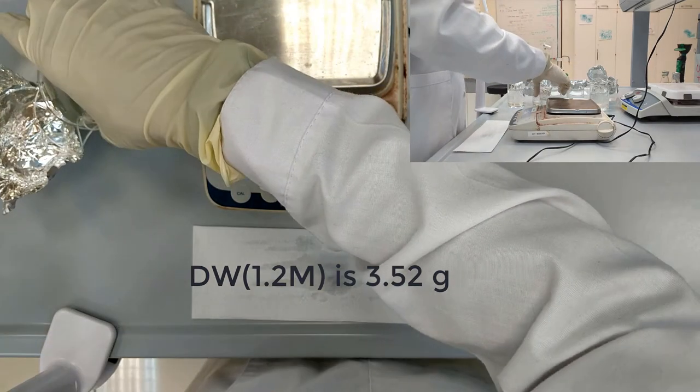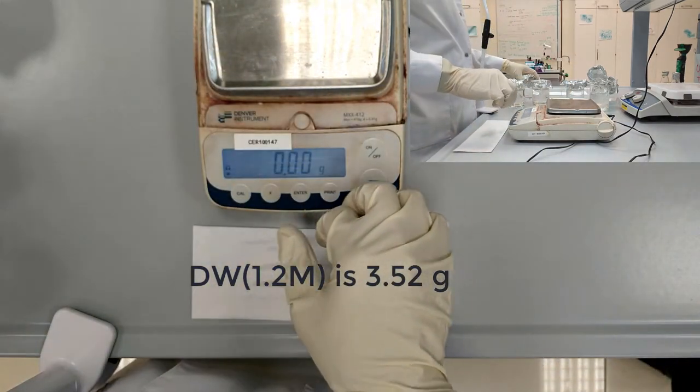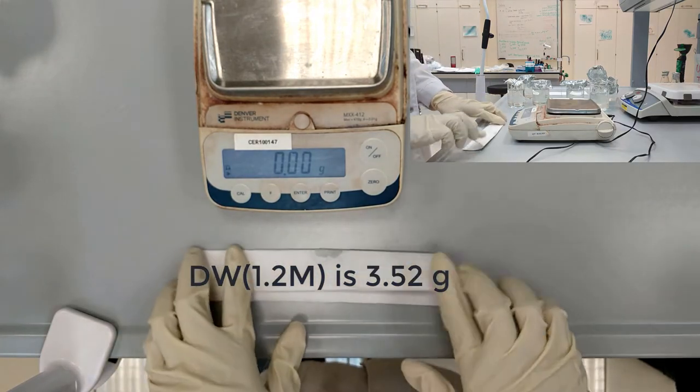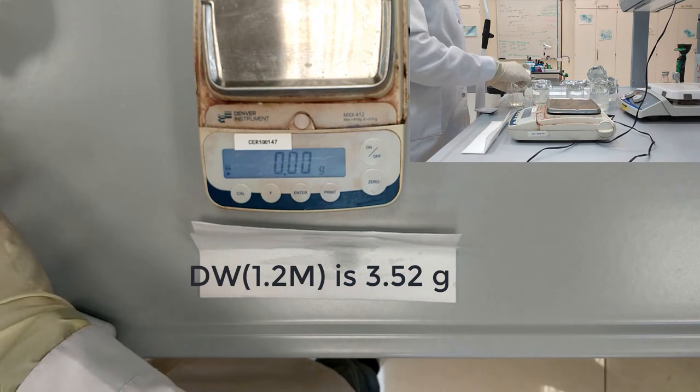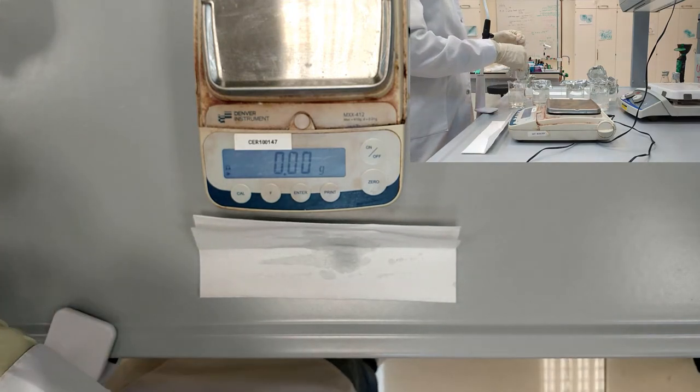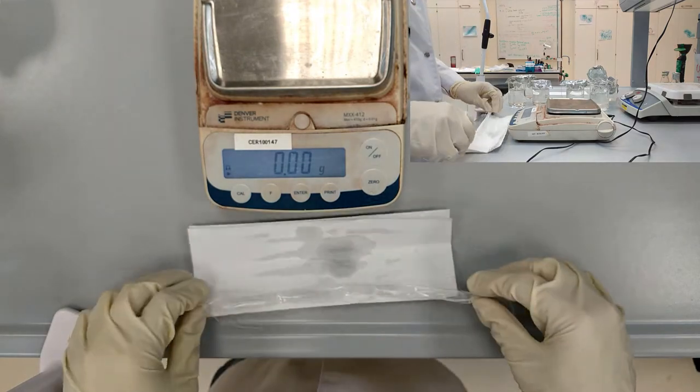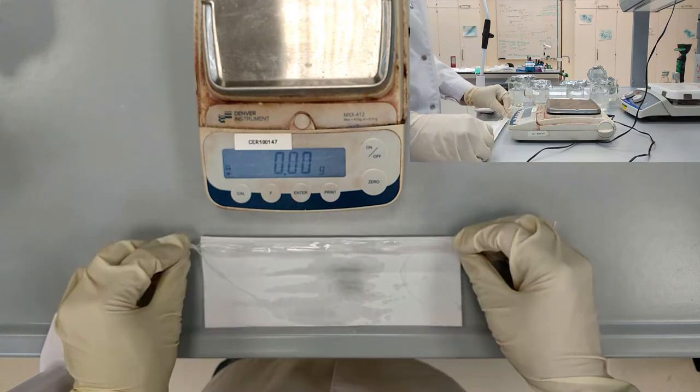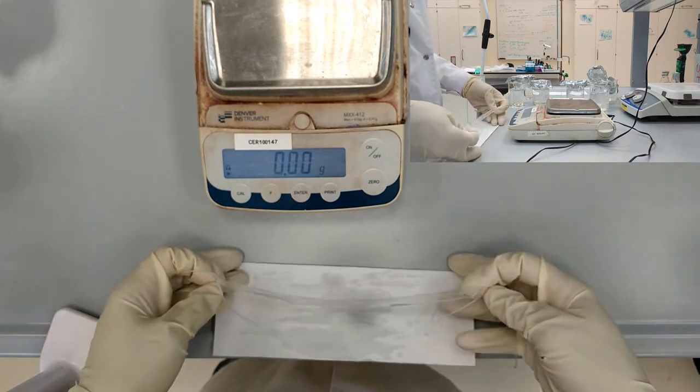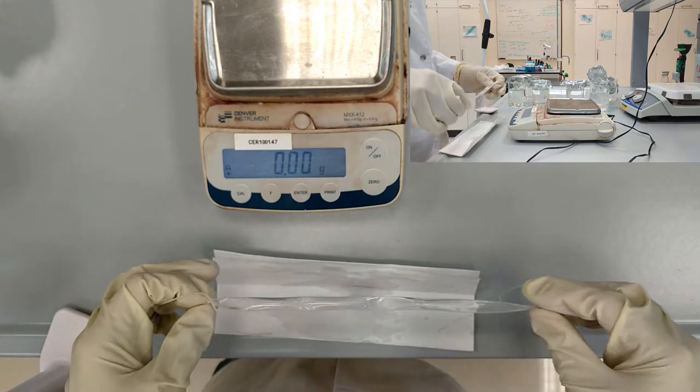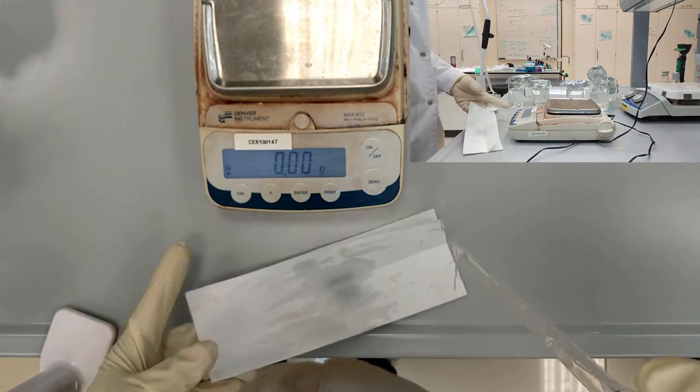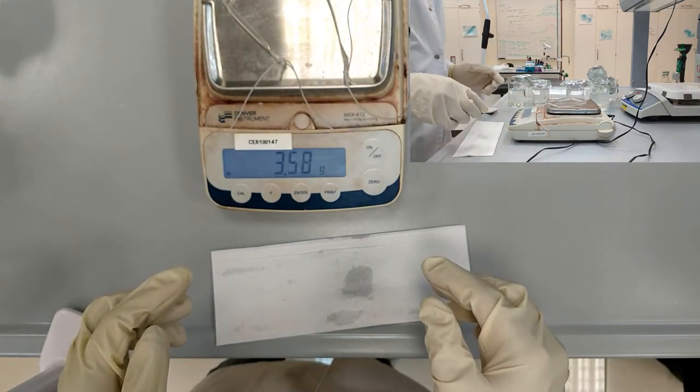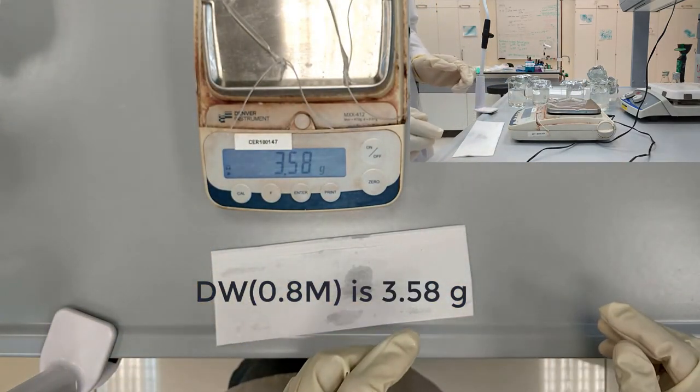Next we take the 0.8 molar concentration and we are going to perform the same actions. First dry the tube and then determine the mass. Now the mass is 3.58 grams.